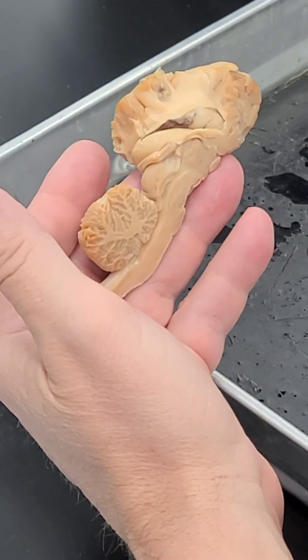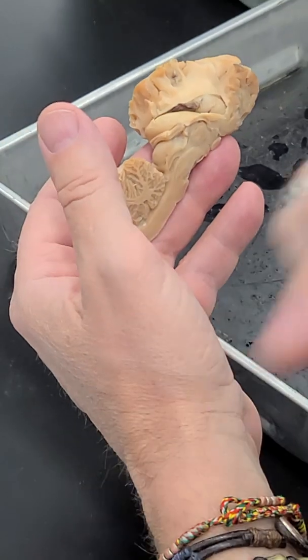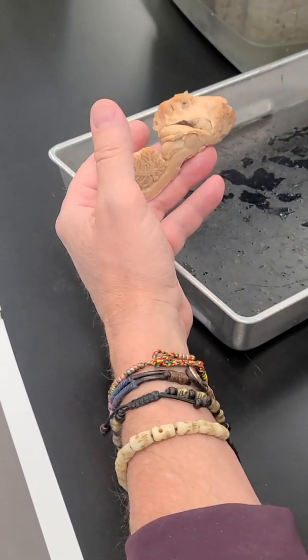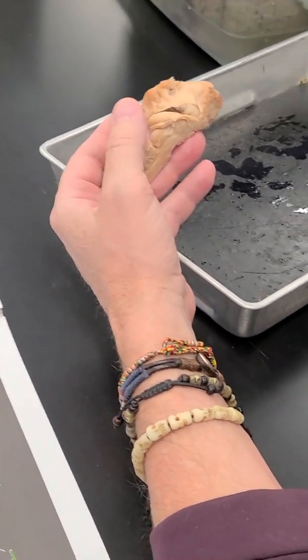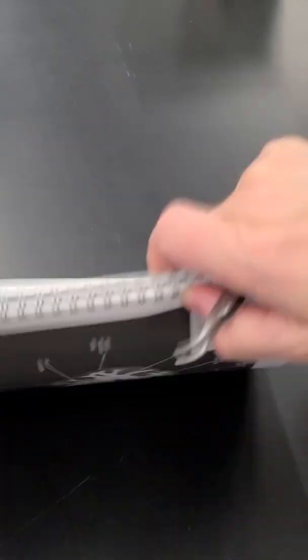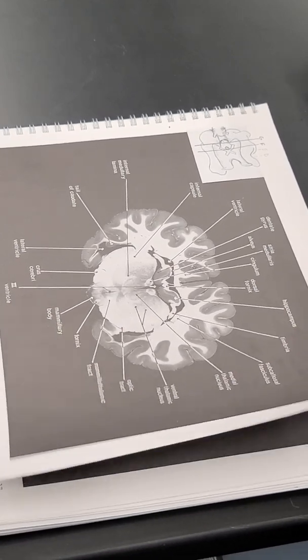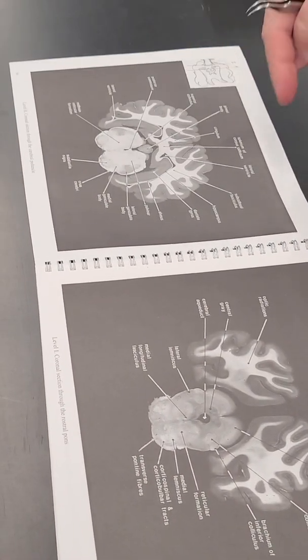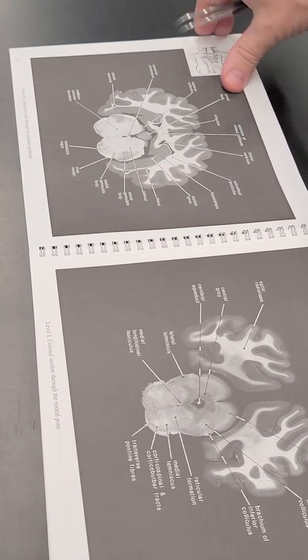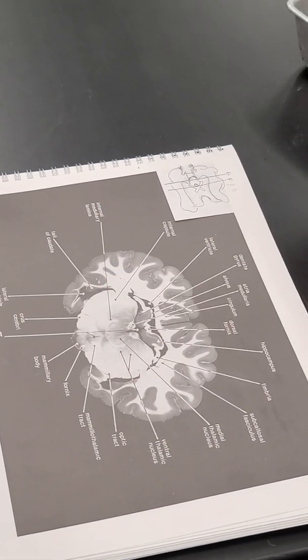Got it? So this helps. I think it helps when you're going through these to be able to envision how one structure is decreasing in size or another one's increasing in size. And it's also real important when you get back to the midbrain that you can think about the lateral ventricle curving around in that C-shaped structure and then progressing forward down in the temporal lobe.